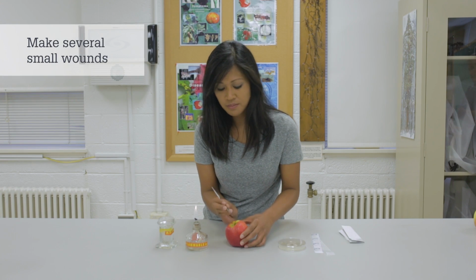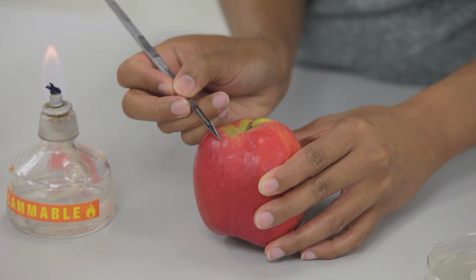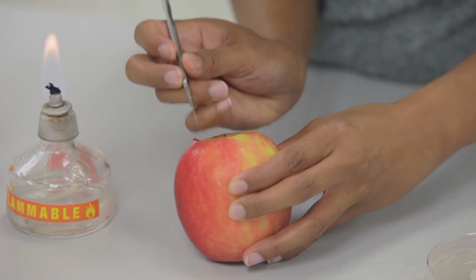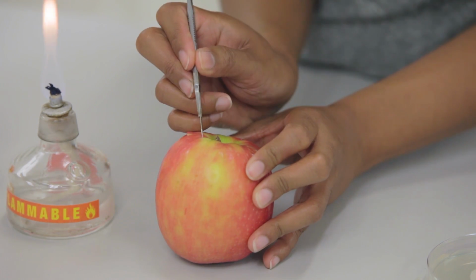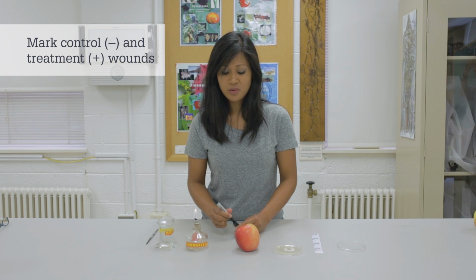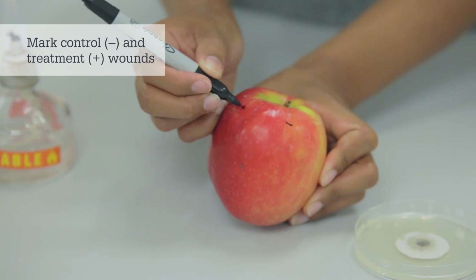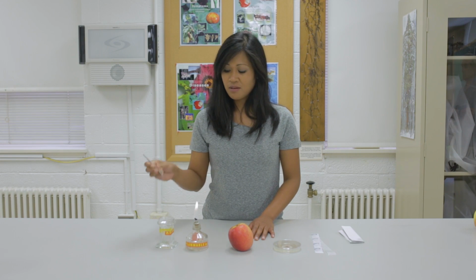Now we'll make several small wounds. Make sure you mark which wound is going to be the control and which ones are going to be inoculated with the pathogen. The first thing we'll do is flame sterilize the scalpel again.